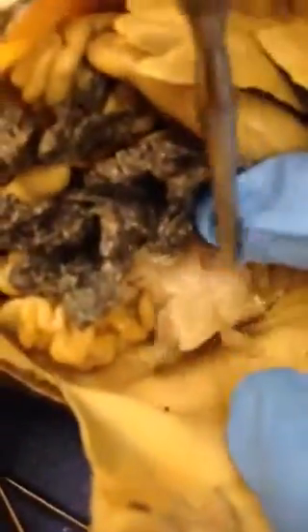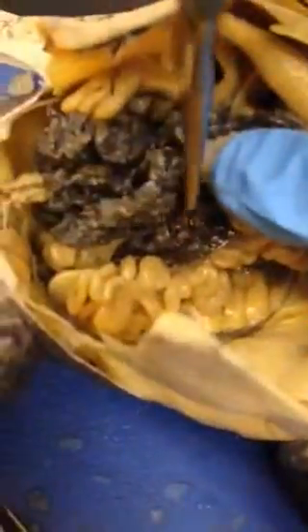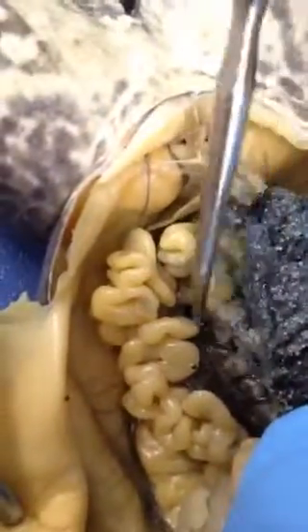We have a piece still attached right here, and we just ripped out all the other stuff because it was in the way. This dark structure right here — let me see if I can get a better angle. Can you see it better now? Lift up the oviducts. This is the kidney, one of them anyway.